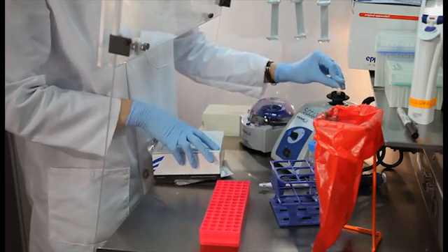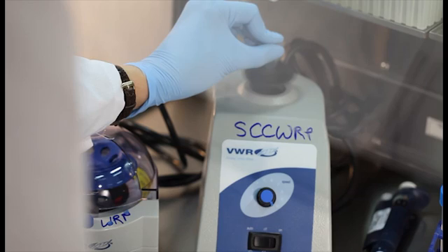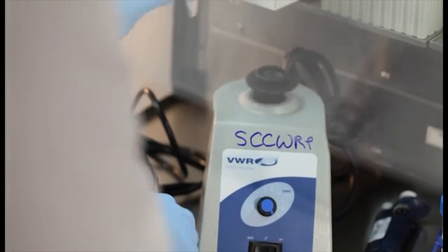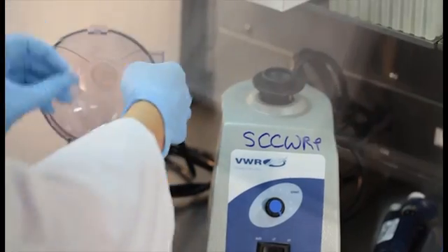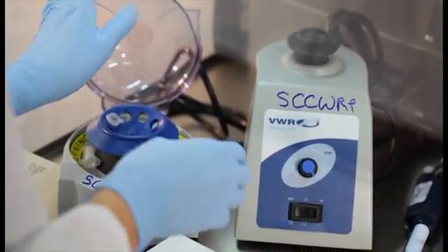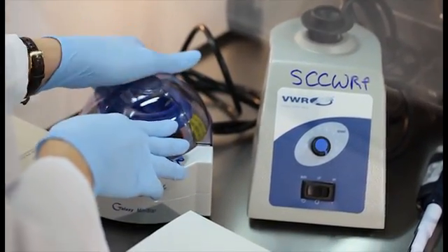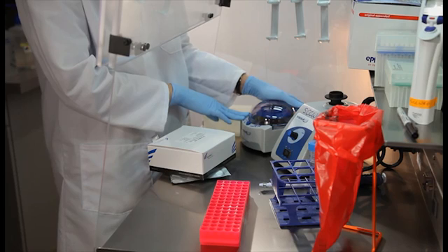Briefly vortex to dissolve the beads. Briefly spin the mastermix to return any aerosolized liquid to solution.